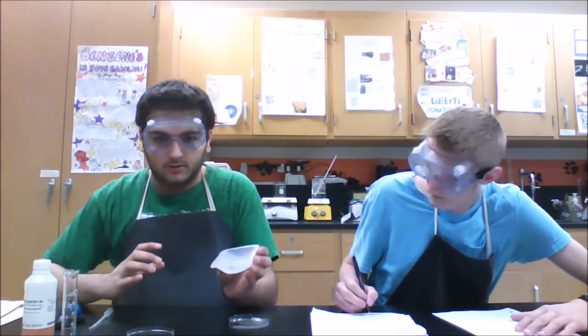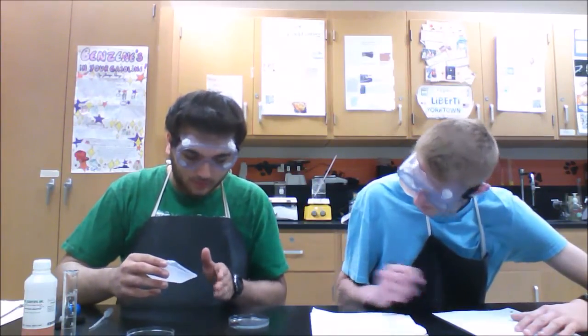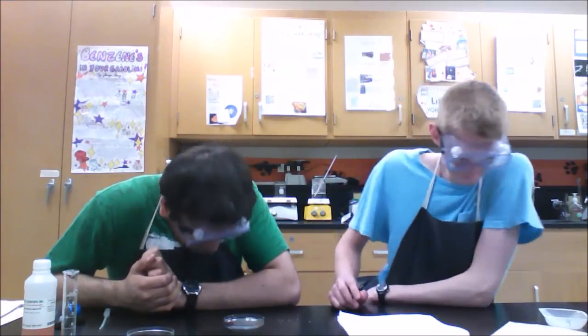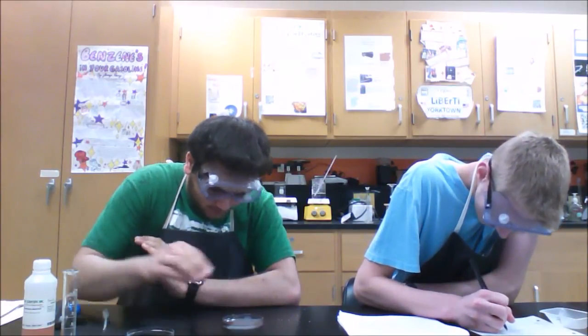And now add a pea-sized amount of potassium thiocyanate crystals, one full pea size. As you can see here, we have the same white crystals. Add them off to the side, and don't let them make contact with the dark red. So you've added your white crystals to the side, and there's already a slightish pinkish around the crystals, but very, very light.